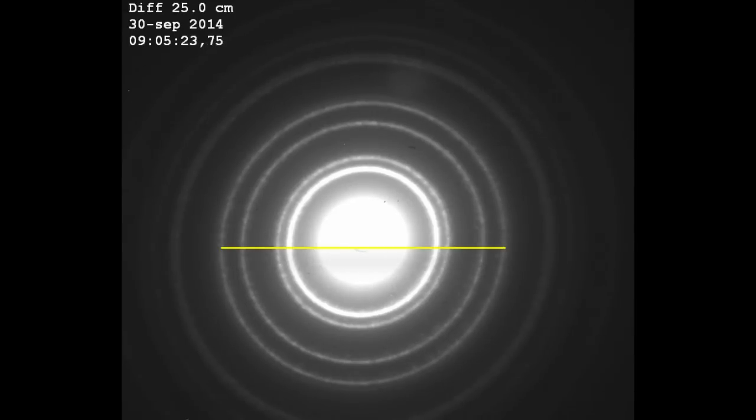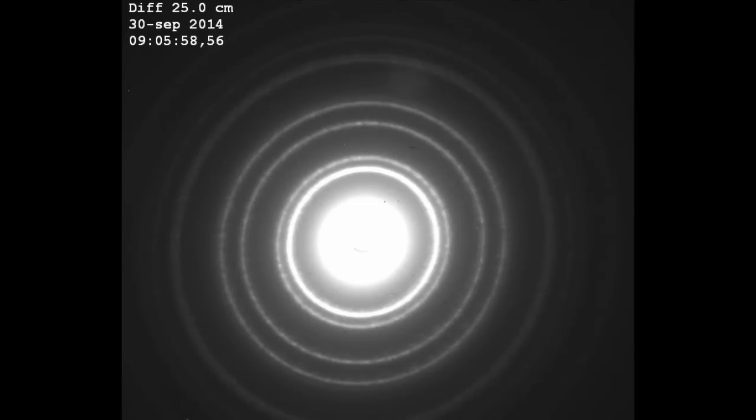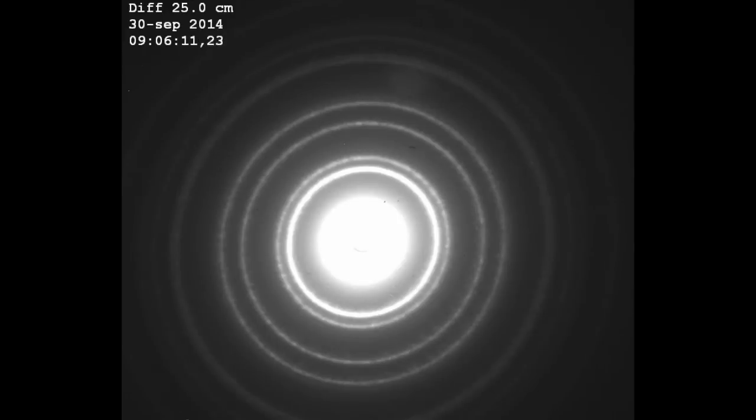The idea here is to use this as a calibration sample — to calibrate the length distances in the image — because we know the lattice spacing of aluminum. By measuring the diameters of these circles, we can calculate a proportional factor that we can then use when we measure our real sample, the molybdenum trioxide. This was the diffraction pattern of the whole region illuminated by the electron beam.